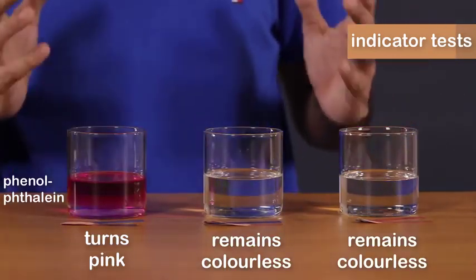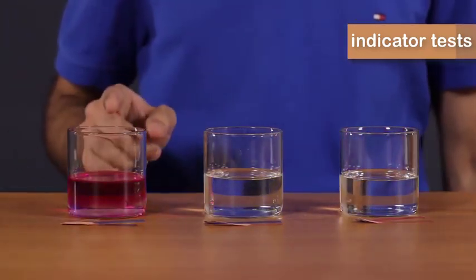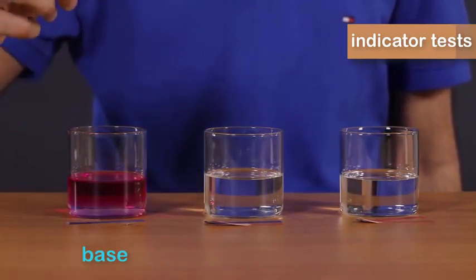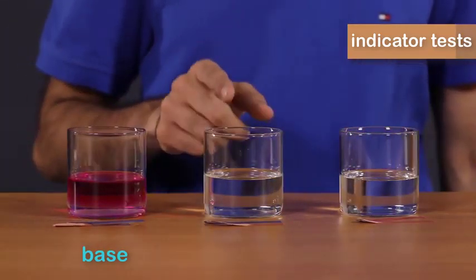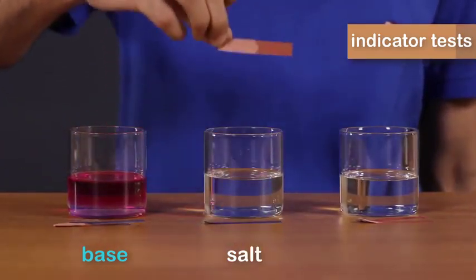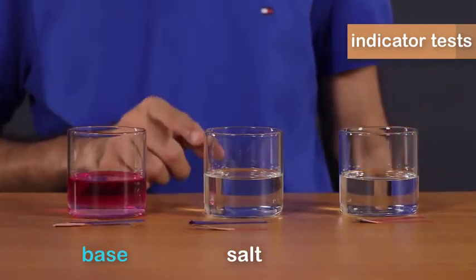So detective, what do these indicators tell you? Let's take a look. So the first solution is a base. The red litmus paper turned blue and the phenolphthalein indicator gave a pink color. The next solution is salt because there's no color change in either of the litmus paper, and the phenolphthalein gave no color change.